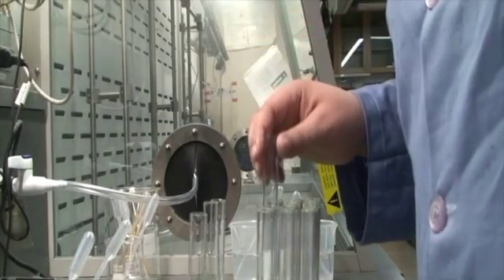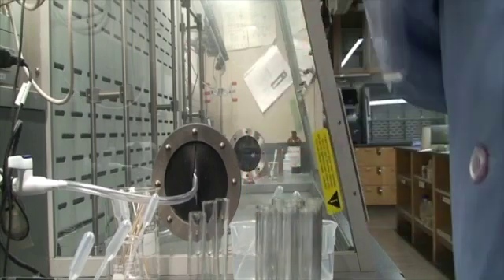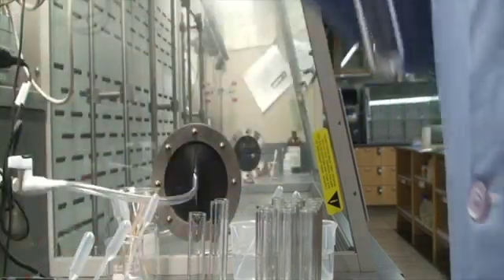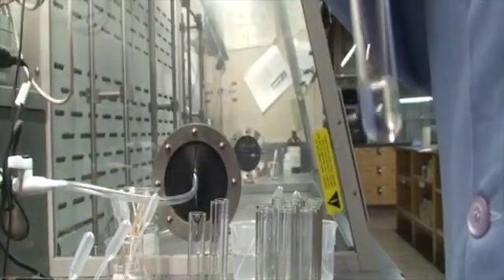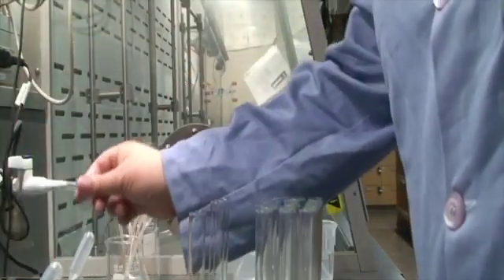Alright, so that was 11 and 12. Let's do 11 and 13. So there's a precipitate for 11 and 12. Okay, this is 11. And 13.